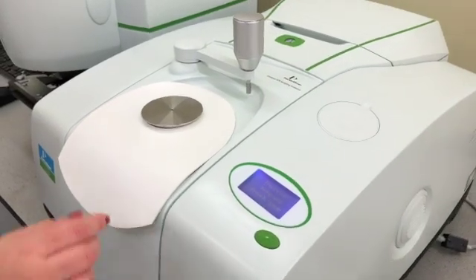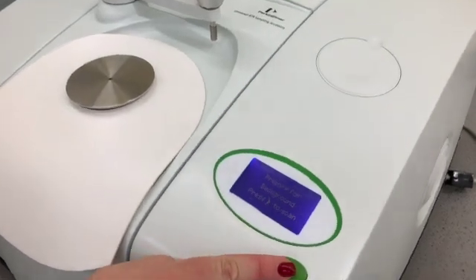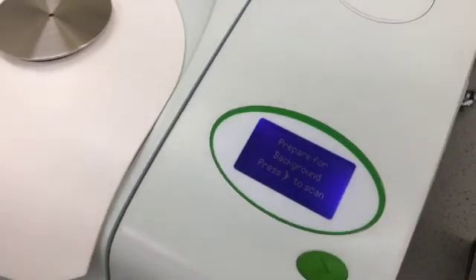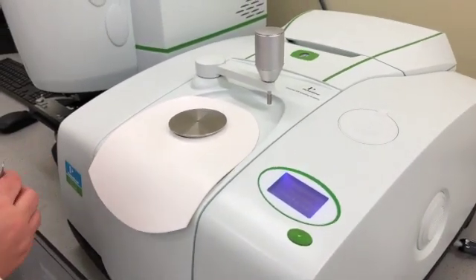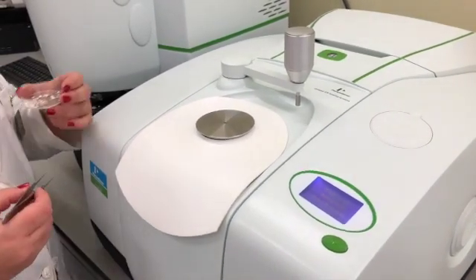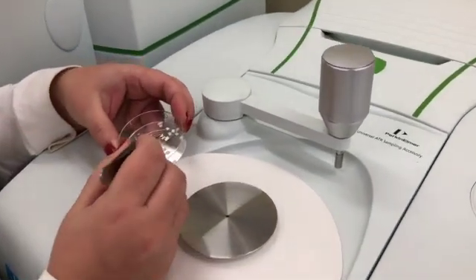What you'll see here is the ATR with the diamond right in the middle. First, we will run a background so that we can eliminate that later. It basically takes in the air component and eliminates it from your actual FTIR spectrum.